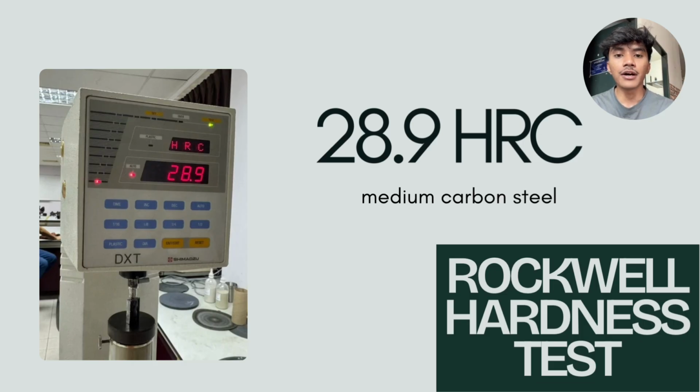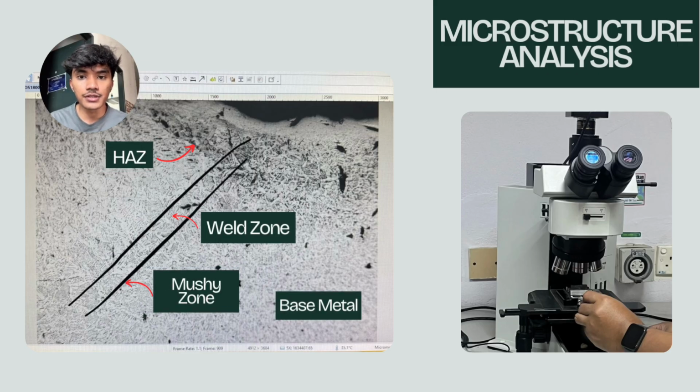The carbon content affects the formation of microstructure during welding and influences the strength and toughness of the weld and heat affected zone. After preparing and etching the sample, the microstructure was observed under an optical microscope.